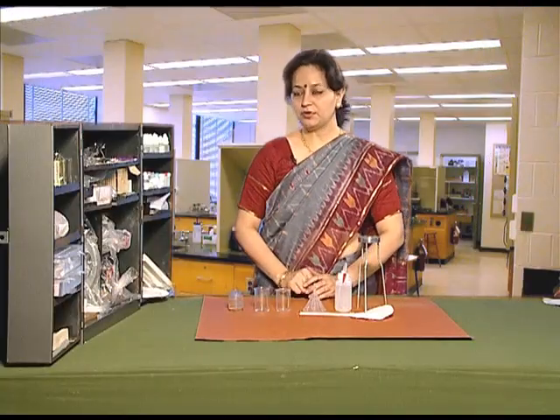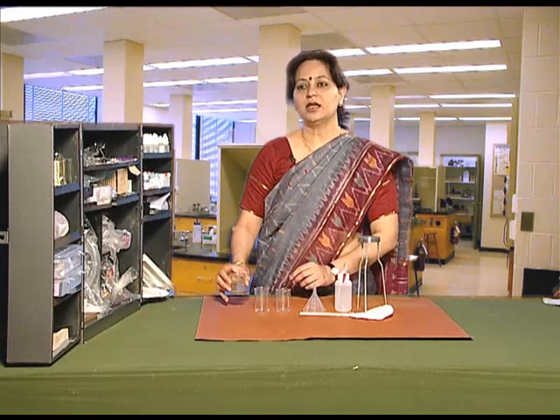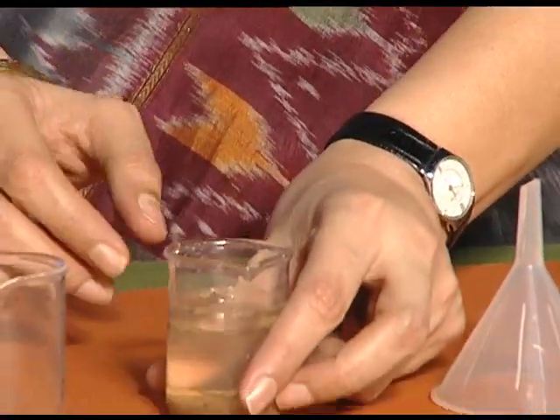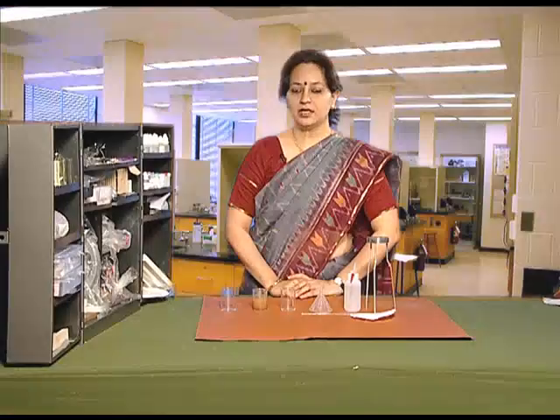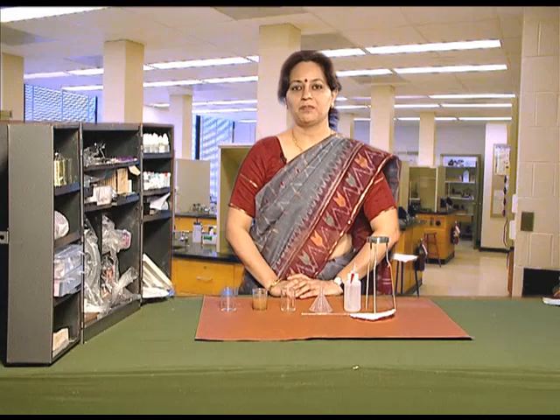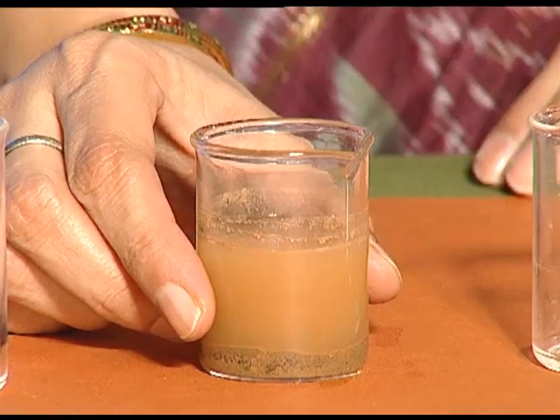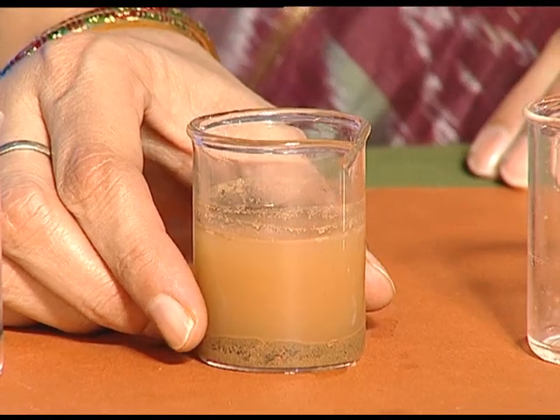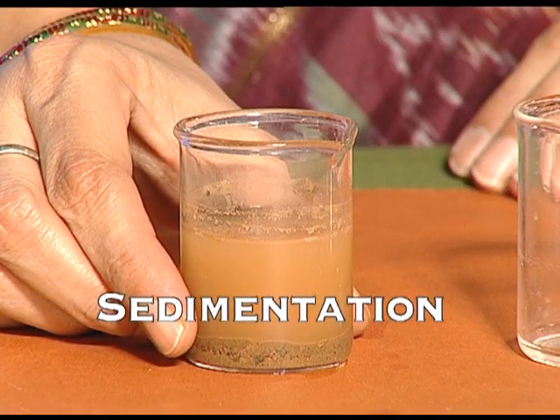First of all, we will take the beaker containing muddy water and leave it undisturbed for some time. After keeping the beaker undisturbed for some time, we see that mud settles down at the bottom of the beaker. This process is called sedimentation.